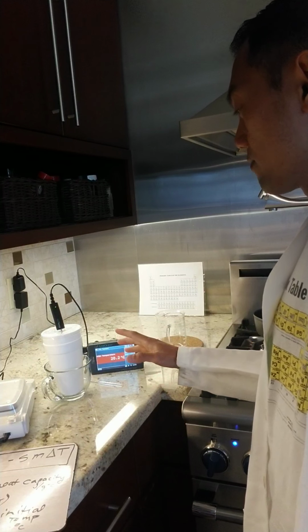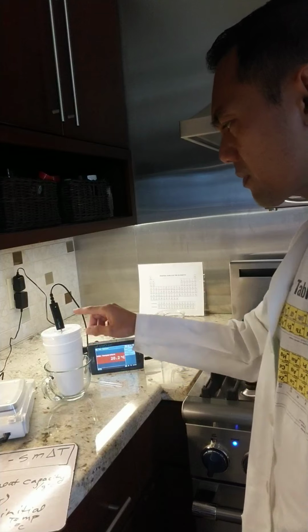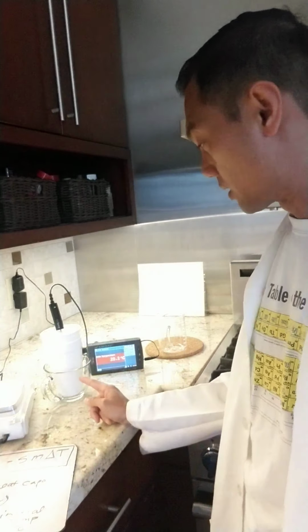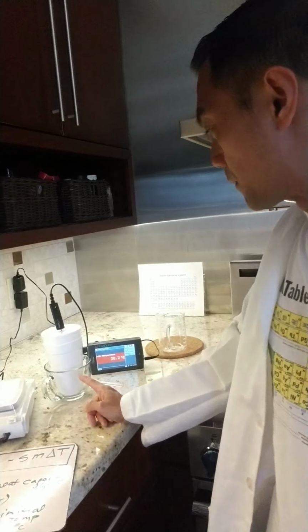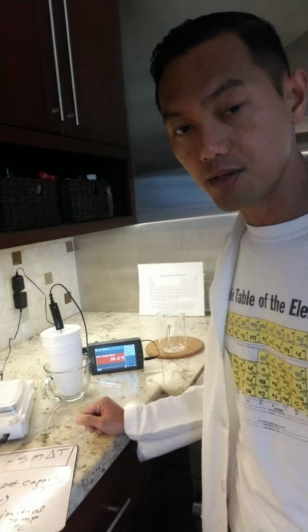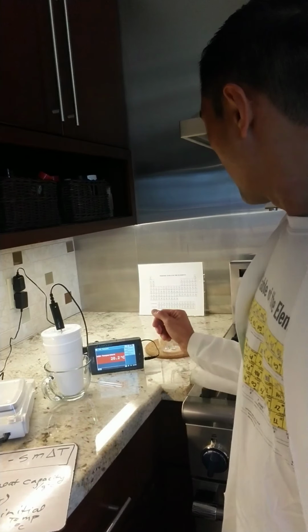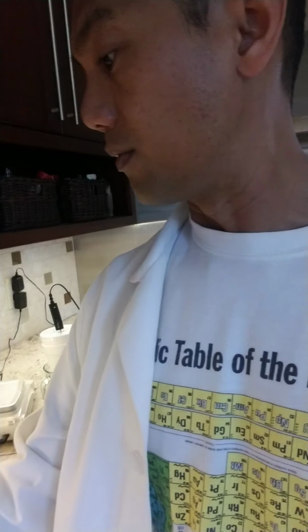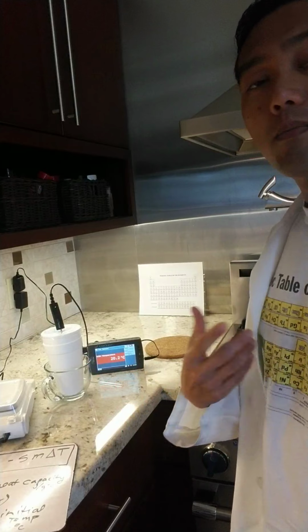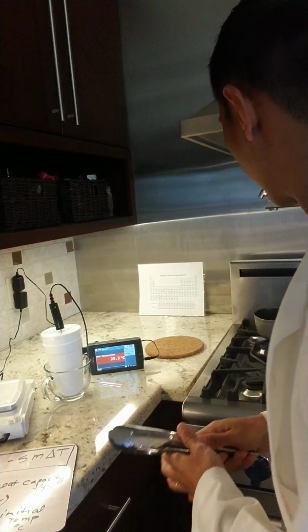And we have our initial temperature of the water for the second experiment, which is metal B. The initial temperature of water is 20.2. It's kind of settled at that temperature. And now what I'm going to do is declutter our space. Same exact procedure as we did earlier. I'm going to move our metal into this, measure the temperature, and hopefully find a point where it holds still, and that's what we're going to be using.